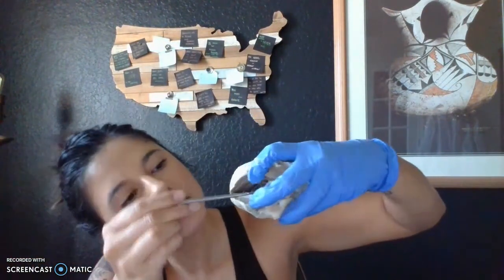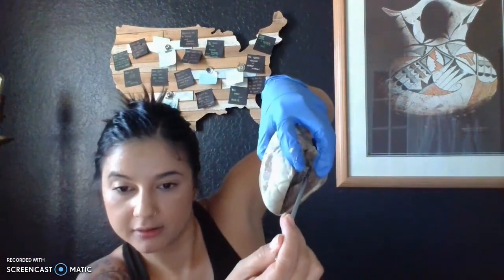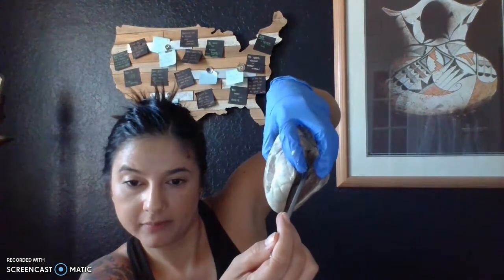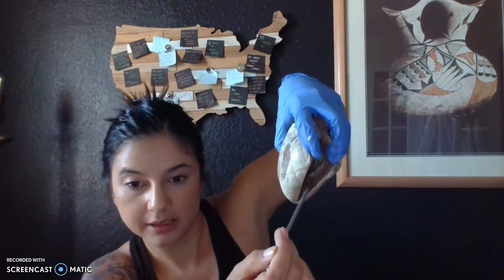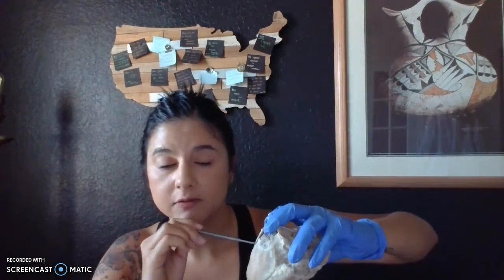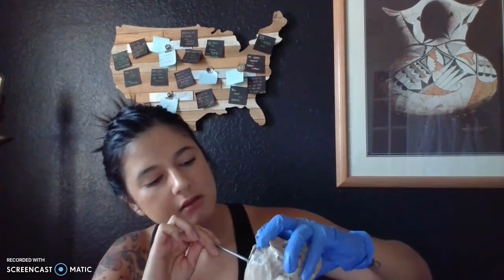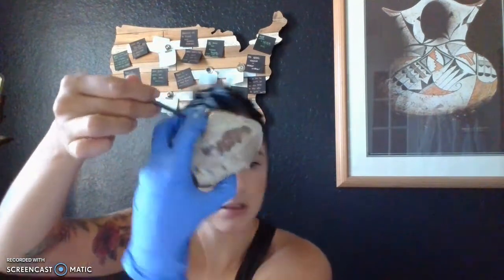Okay, so we have the left atrium in here, left ventricle. Again, I'm just looking to make sure I'm pointing at the right thing. And then the mitral valve connects the two. The valves are each held in by, let's see if we can, I'm going to invert it.